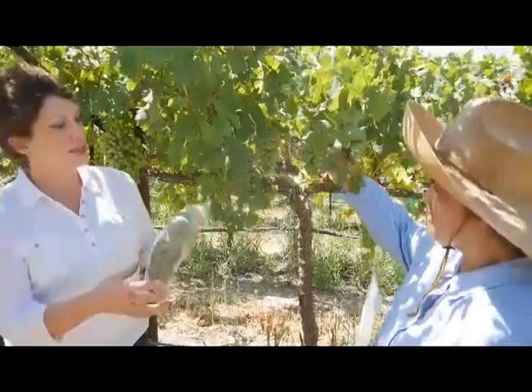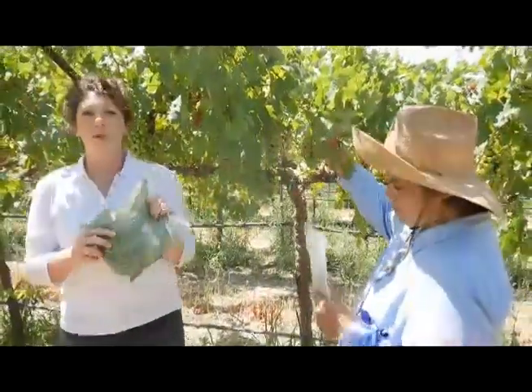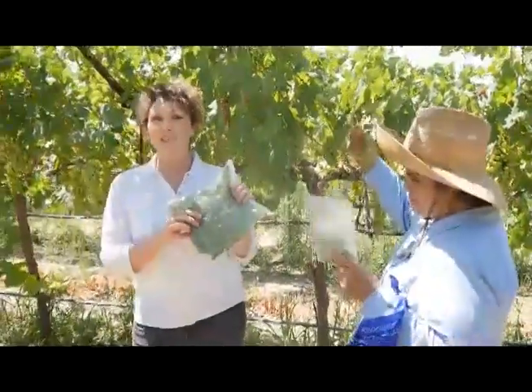We separate the leaf samples — about 80 grams each — and put them in separate bags, then we prepare them for shipment.